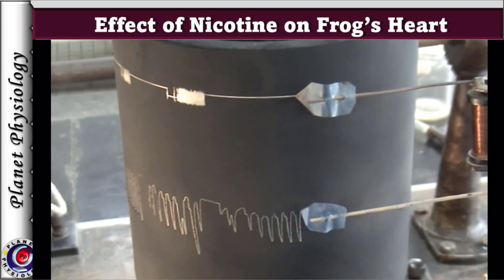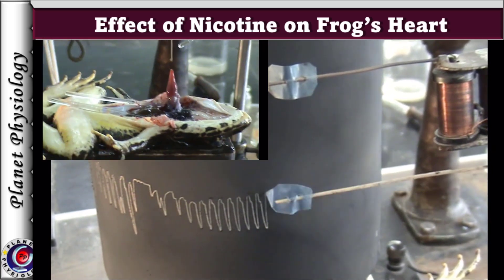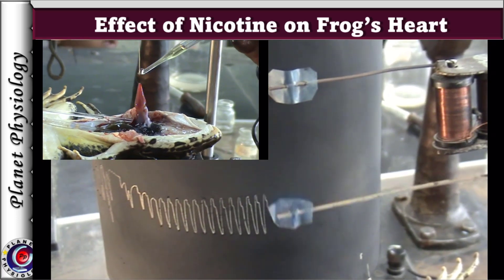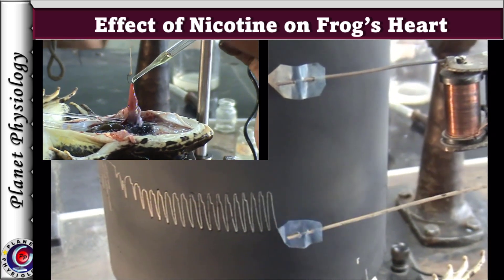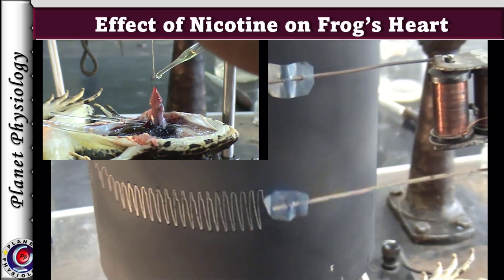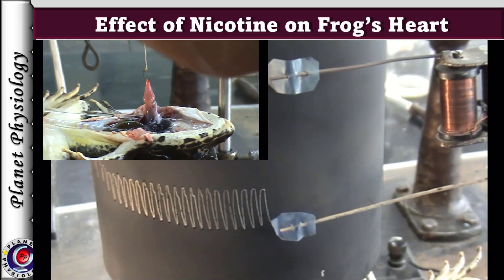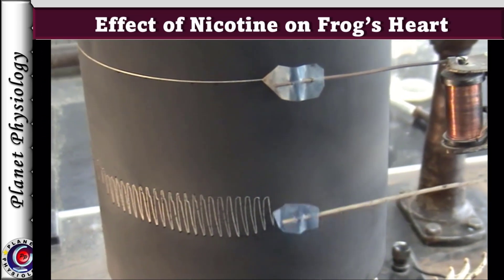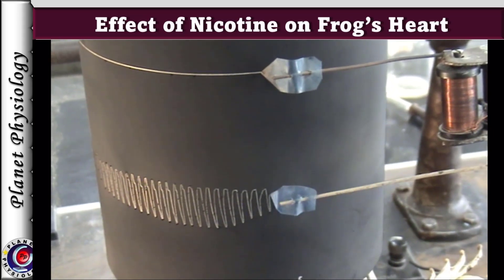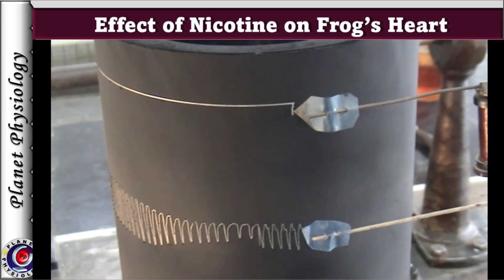Now, a few drops of dilute nicotine are added to the ventricle using a dropper. Observe that heart rate and force of contraction has decreased.